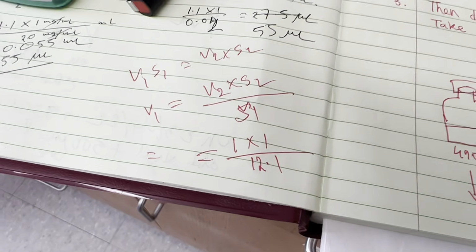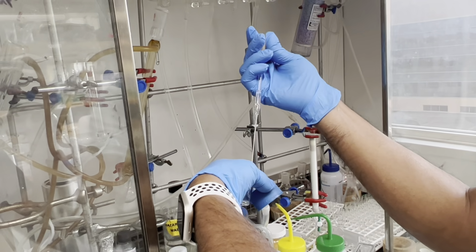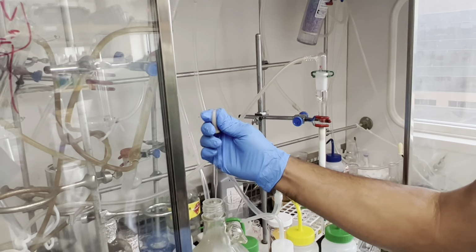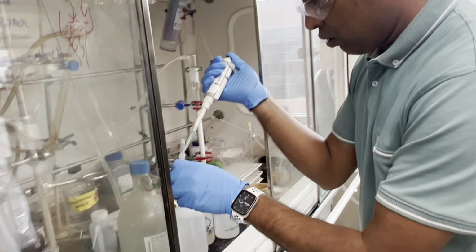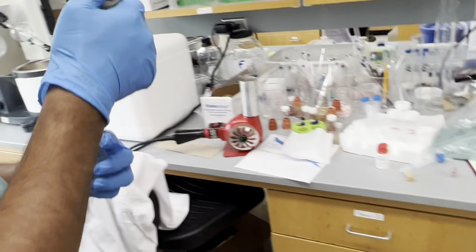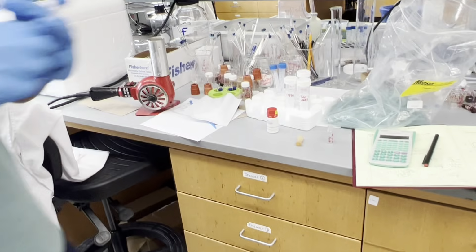Damn, this is long. Fractions over here. Calculated that. Wait, is it even going to reach? Looks difficult too. But you need to learn, right? Oh yeah, I'm more than happy to learn it. You will be doing many things next year or later this year, I don't know. But I just gotta get this synthesis going.